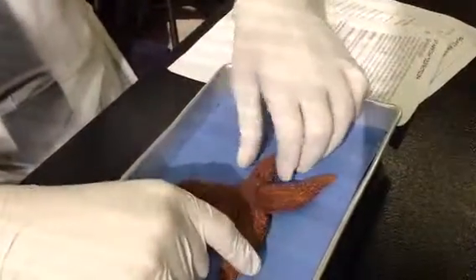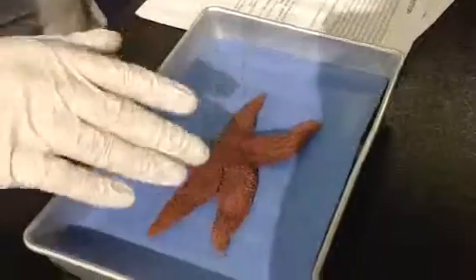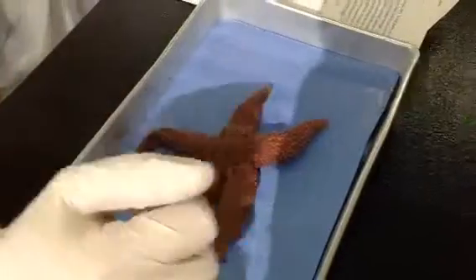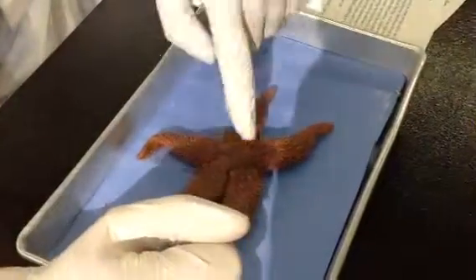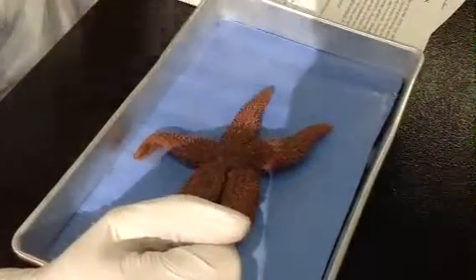Hello, we are dissecting the starfish today. This is the aboral side of the starfish. Here are the arms in red, projecting from the disc.